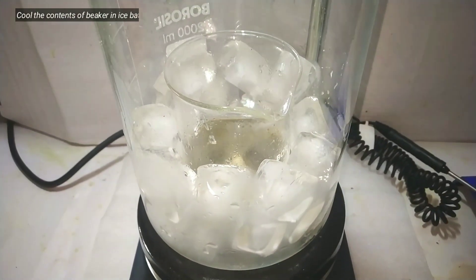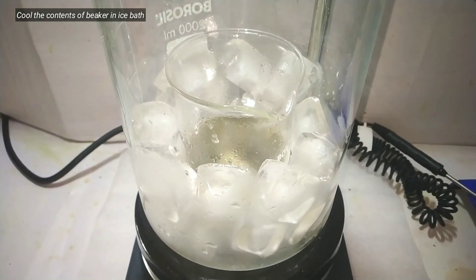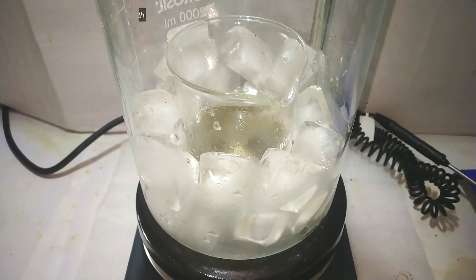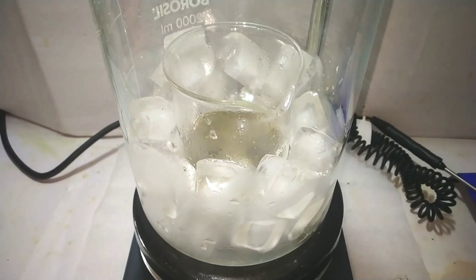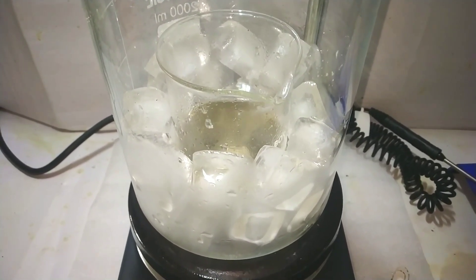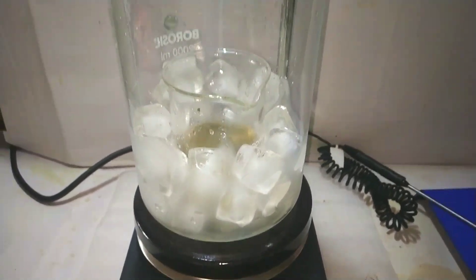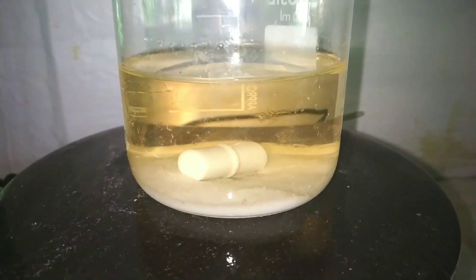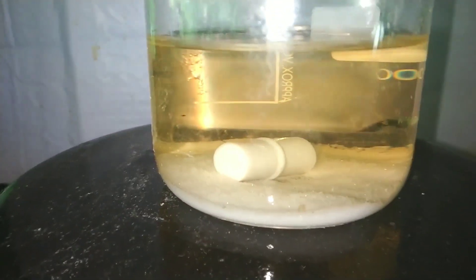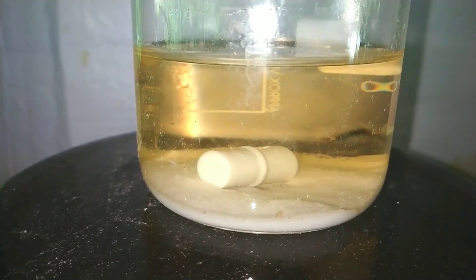After 30 minutes of heating, the solution was then cooled down in an ice bath. Here you can see that the hydrazine sulfate crystals have settled down at the bottom of the beaker.